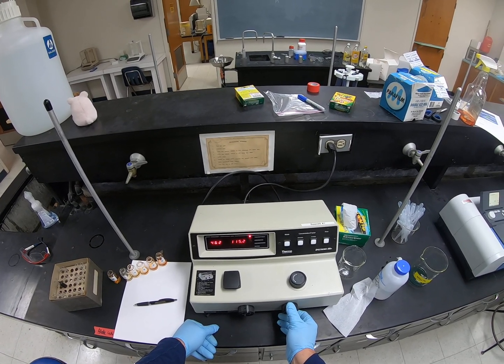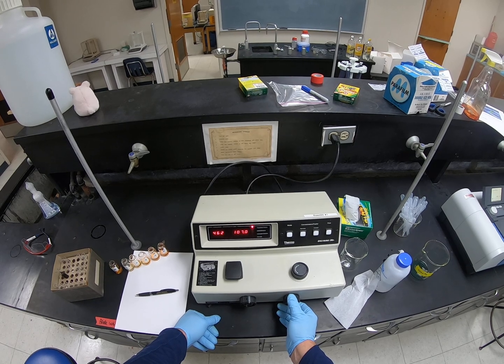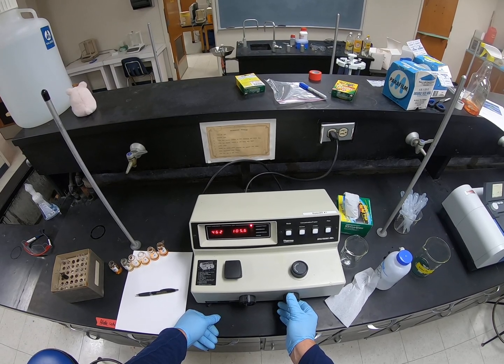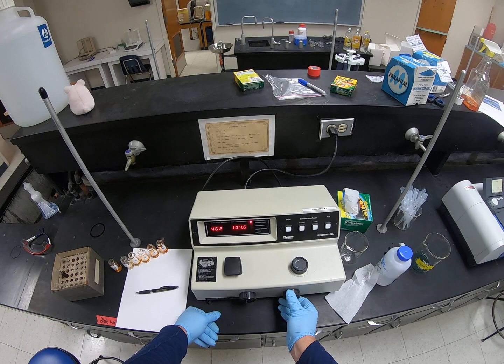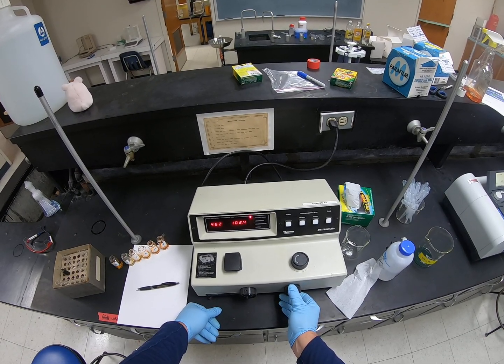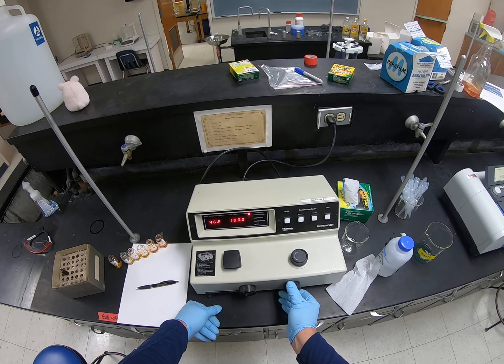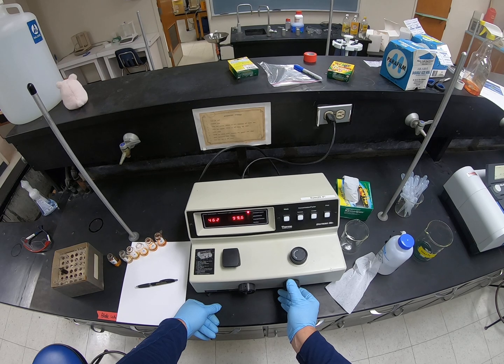Now this one's a little bit more finicky to get to the perfect 100. But maybe we can get it there. A little too far.